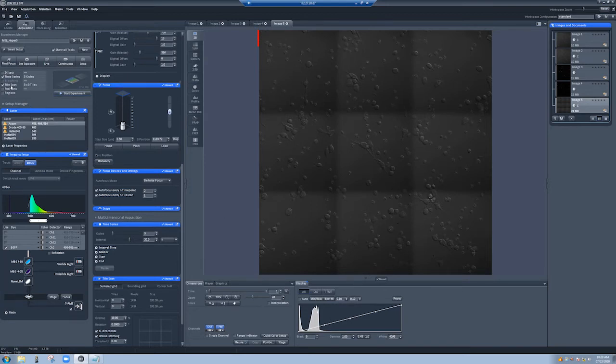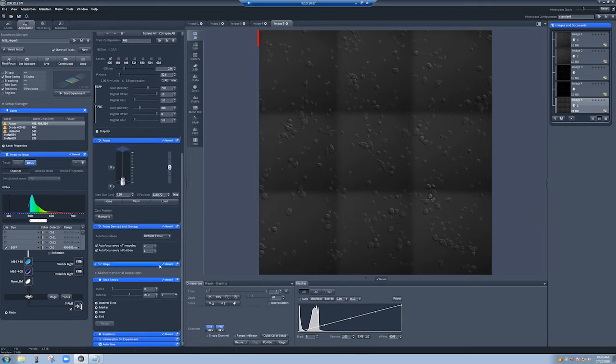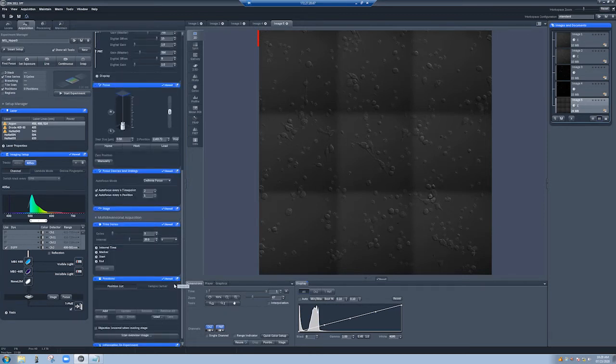To do that, we're going to use the positions tab. The way this works, if you go here, is we have a list of positions to which we can add. We can either go to live and just move around and add positions as we have them, or we can do this strategy where we take a low mag, not a low mag, but this sort of tiling, and then use this map as a way to find positions. I've done that here, and I will show you an alternative for how to do that same strategy.